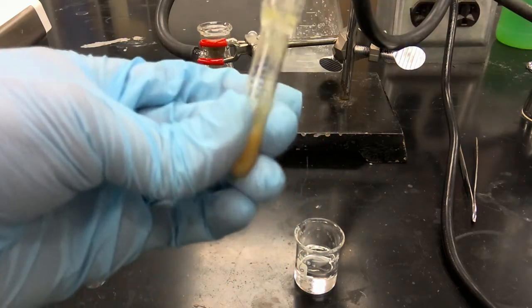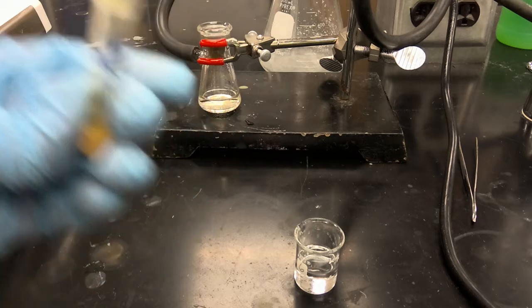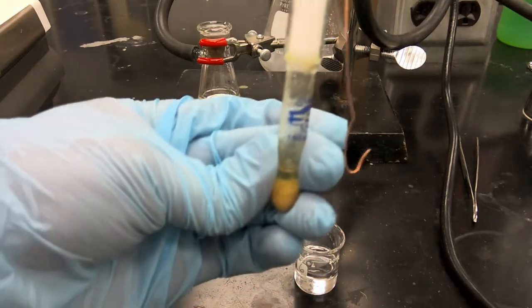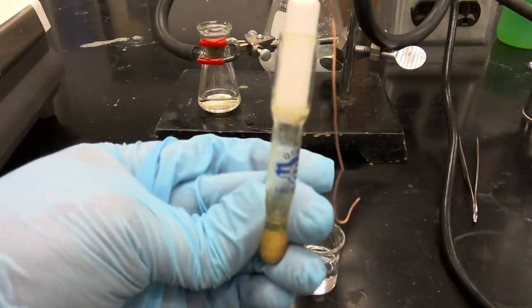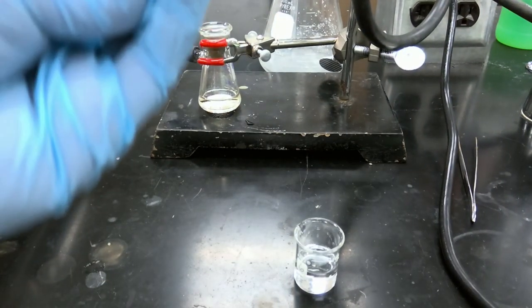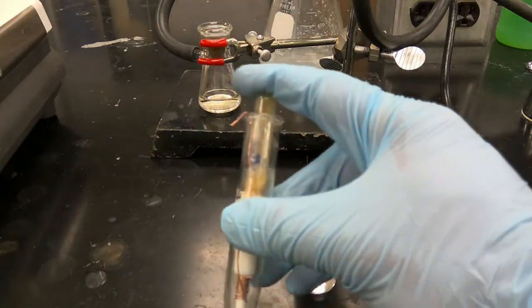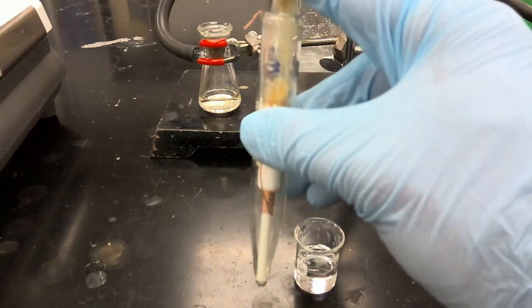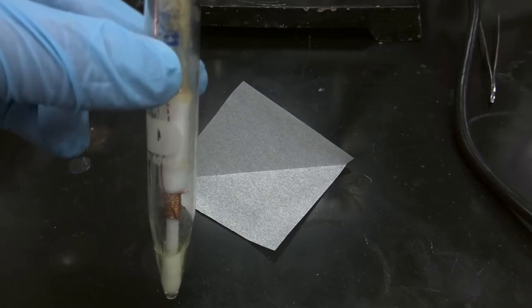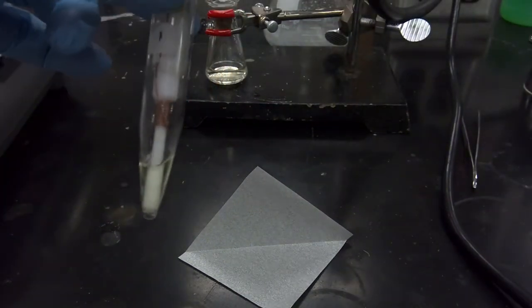So now we're going to separate our solid and supernatant liquid via centrifugation. So we're going to set up our Craig tube cap, and we're going to add our conical vial cap. And now that we have everything securely set up, we're going to invert our Craig tube, and we'll separate the solid and supernatant liquid one last time via centrifugation. Okay, so again, as always, we're going to separate our solid and supernatant liquid.